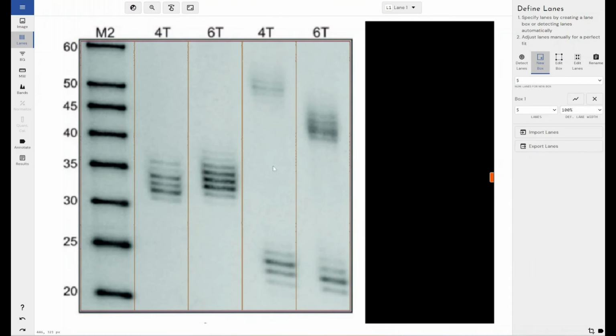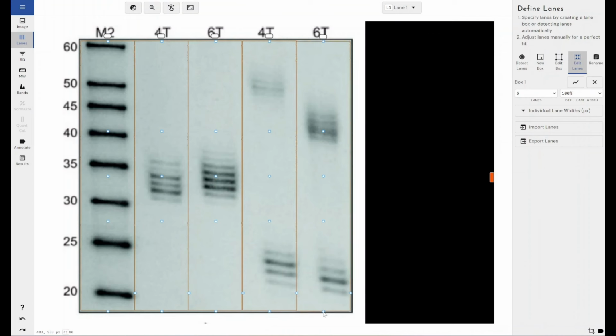Left click to release. Now I can see for the first 3 lanes, all of the bands are contained within the lane, so that's fine. However, for these last 2 lanes, they're slightly warped, they're slightly bent. So what I'm going to need to do is bend my lane boxes to accommodate for that. And that's super easy as well. So if I just click this handle here, I can bend my lane. And what I want to do as well is just shrink this lane down so I can make sure that I'm capturing only the band information and not this strong border here. And I will bring this lane down as well and move it to match the bend that I've got in my other lane.